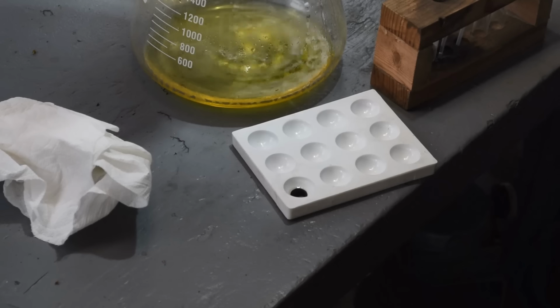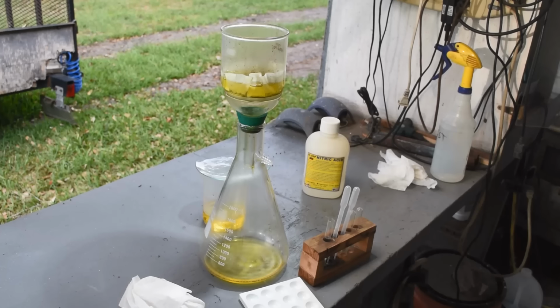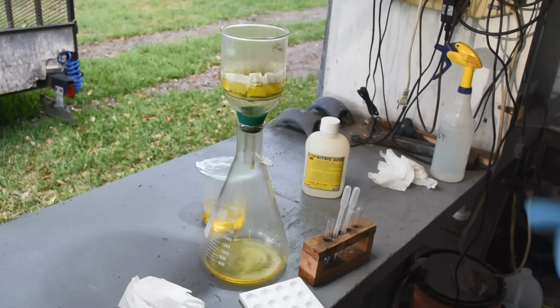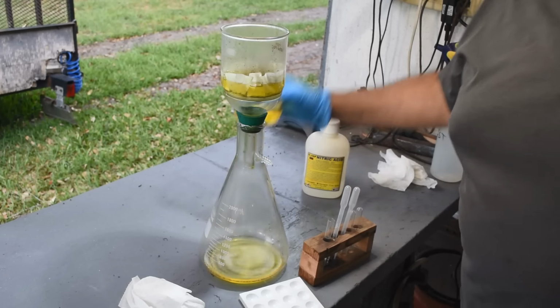Yeah, it's dissolving away in there good. It's bubbling. Yeah, we got a real good reaction going on in here, and that stuff is disappearing. So yeah. All right, everything is just working perfectly. So I'm going to put a little bit more of the aqua regia through.